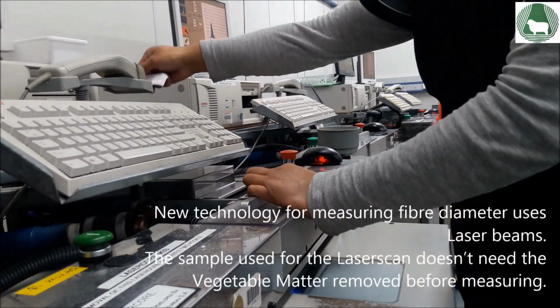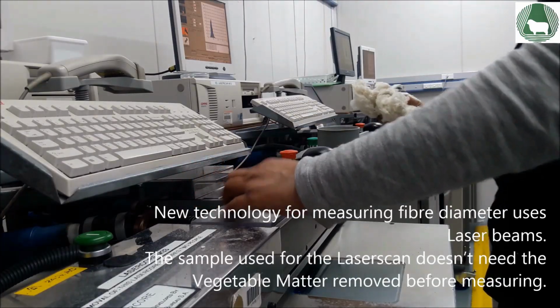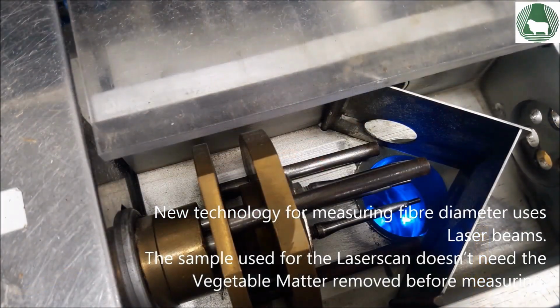The sample used for the laser scan doesn't need the vegetable matter removed before measuring, but to measure we use a mini core to present thousands of fibres to the instrument.